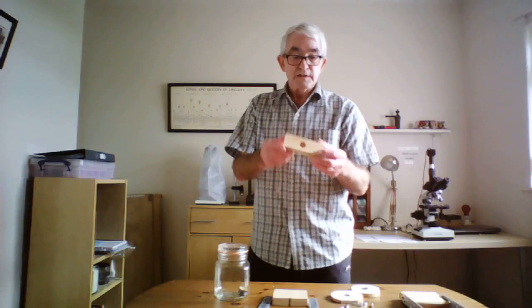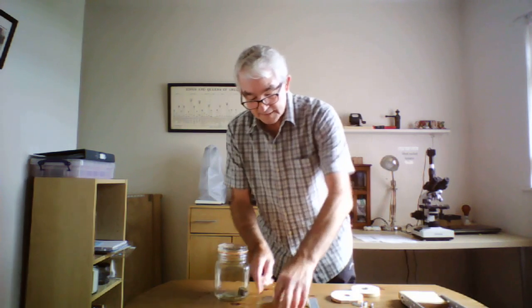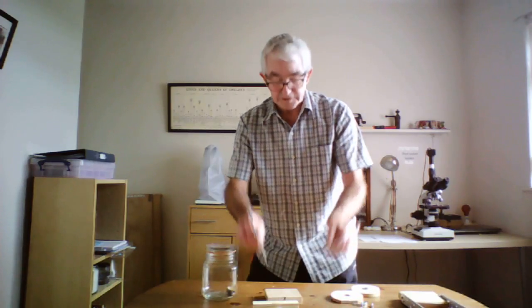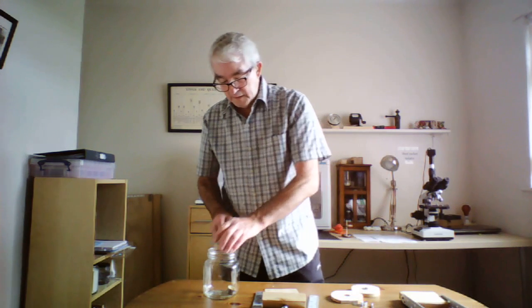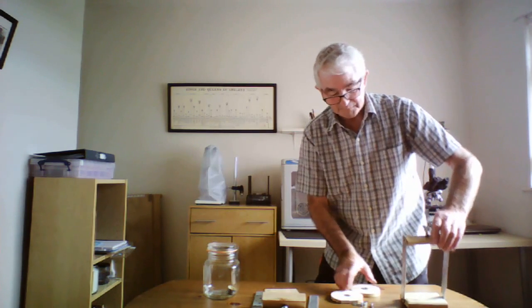What I've done: a piece of wood, drilled half inch all through so that a bolt will fit through it — which is that section there. Then I've got a base here. Two side pieces to screw to the base, and screw to this top, which then forms that. Then the jar, which has a rubber seal. And once you've got this airtight, it's placed into this clamp. This is a piece of wood with that all half drilled through, and a coin placed in to stop the wood from being worn away when you tighten the clamp down.